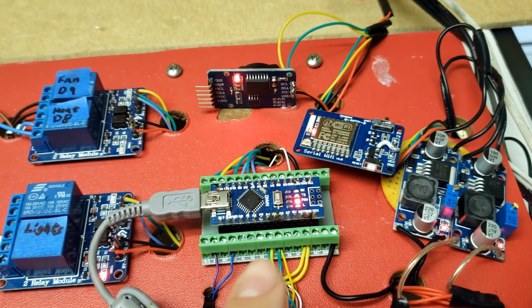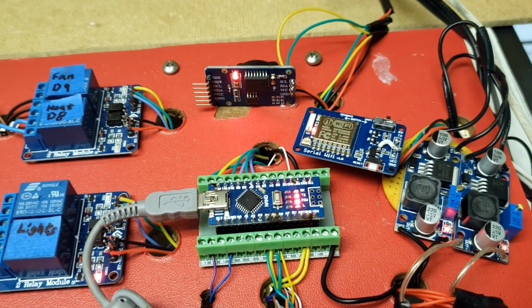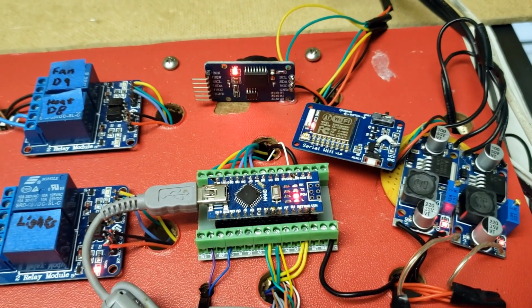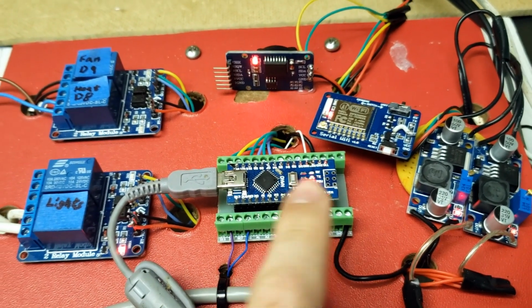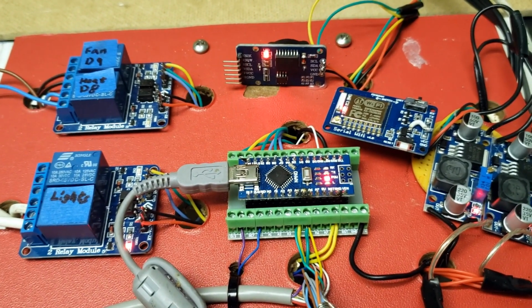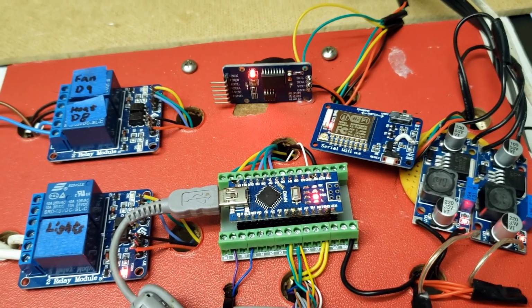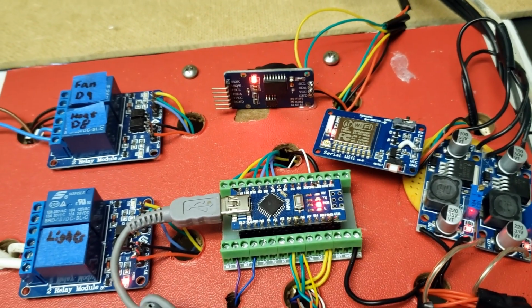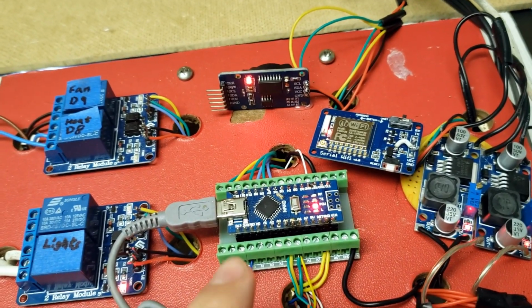Some people might ask, if they're into this kind of thing, why I'm not just using something like a Node MCU or an Arduino with a Wi-Fi board already on it. Believe me, I wish I would have, in hindsight. I did not add the Wi-Fi until the very end. So looking back, if I was to do this again, I would definitely just use a Node MCU, something like that. It would have made things much simpler. Oh well, hindsight is 20/20. Now I have redundancy if one of them goes down. That'll help me know if something goes wrong.